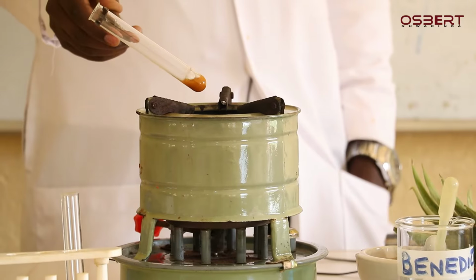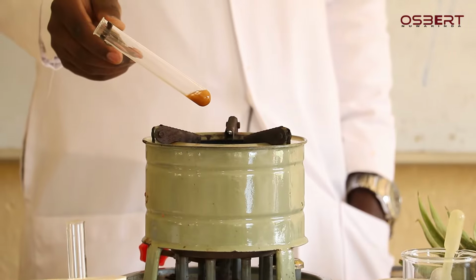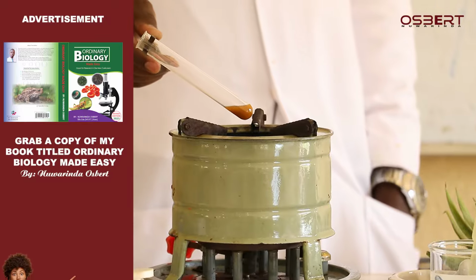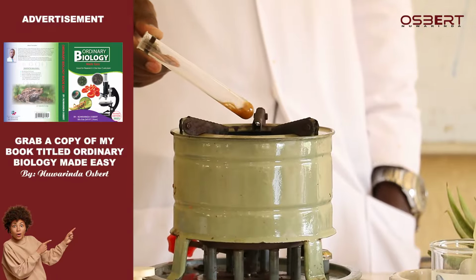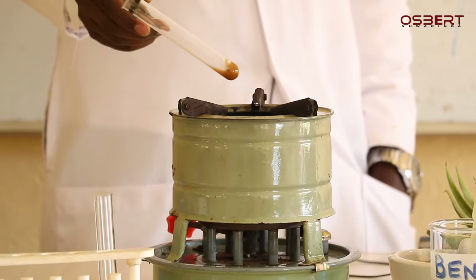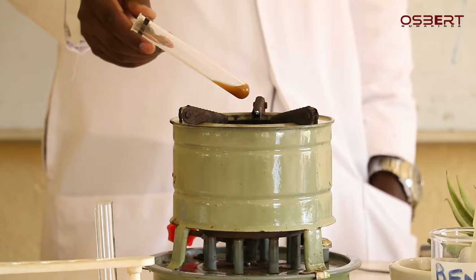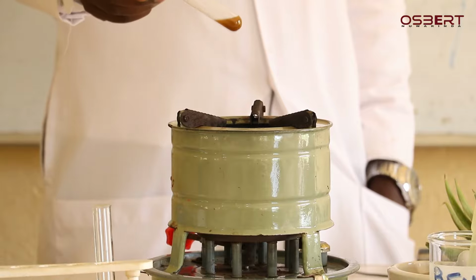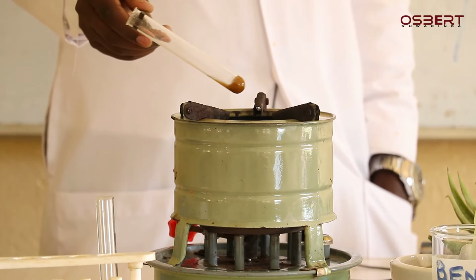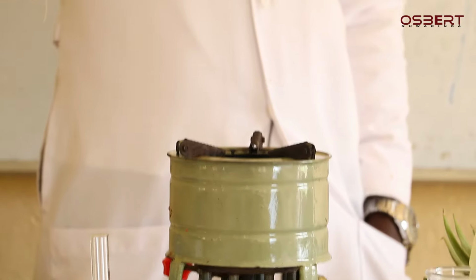However, some of you might say, but teacher, those colors have turned before the boiling. Yes, sometimes the colors might turn before the boiling as long as the heat comes in. But for you to confirm the final product, the solution must first boil. If it has not boiled, then you're not supposed to conclude. When you check now, because I've seriously boiled, you see the orange I had is now turning into brown. Orange is somehow much more shining compared to brown. See? So you are seeing the color has now turned from what I had.